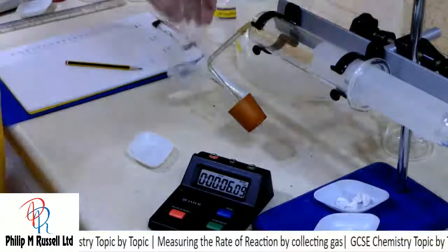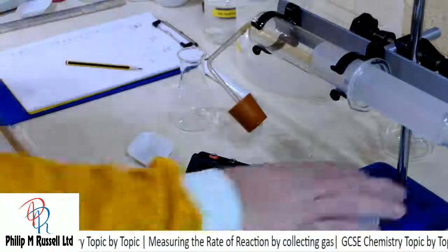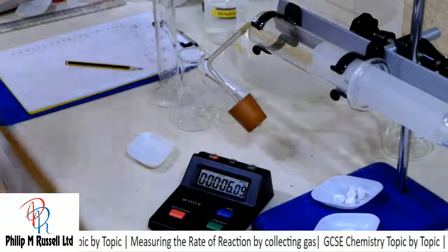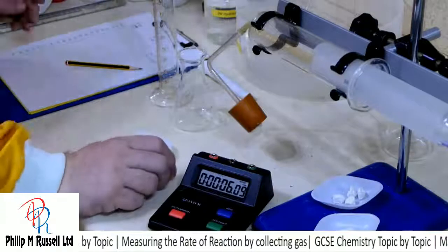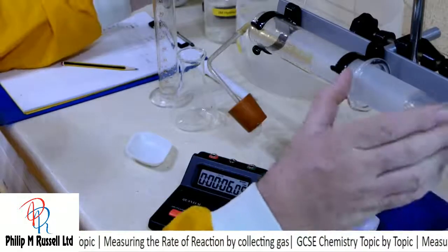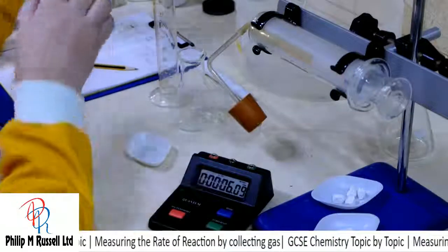So let's try this experiment again. This time I'm going to do it with the same amount of acid, but we're going to do it with these larger lumps, and I'm predicting this is going to be perhaps a little slower.